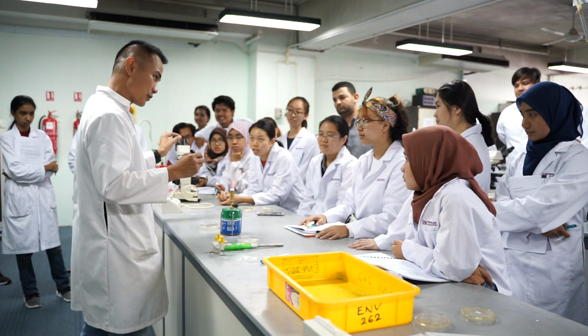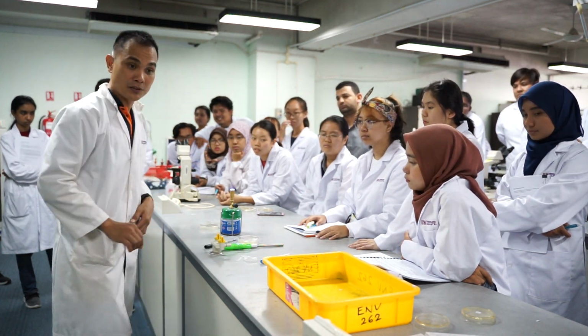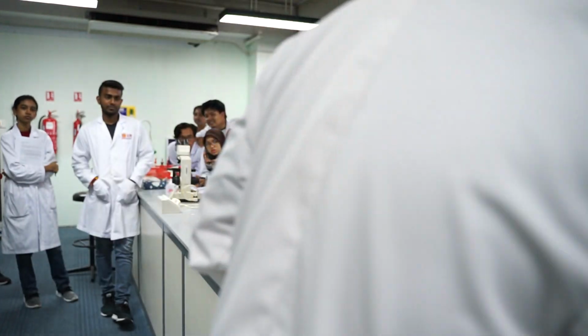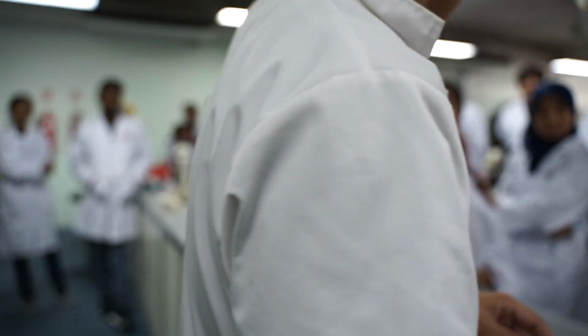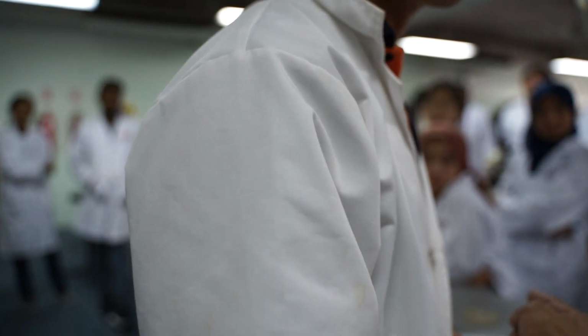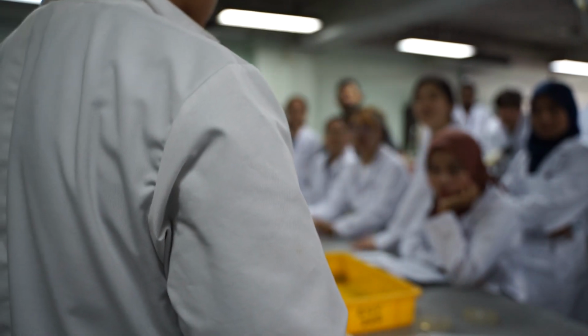Like last week you used the glass rod, yeah? Okay, but actually I want to show you still, because last week our alcohol didn't work, so I want to show you. Where is the rod? Because last week it didn't work, so I want to show them. Sorry, we just want to show you because last week our hockey stick doesn't work, yeah? So we want to show, yeah. It is called hockey stick.